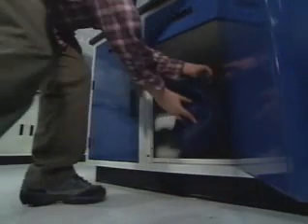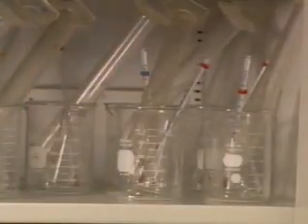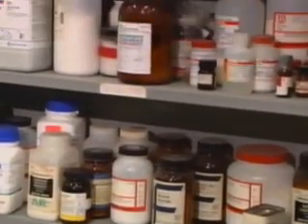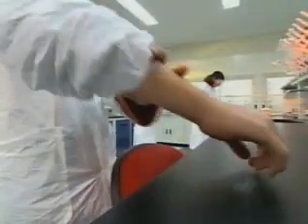Well, they're certainly off to a good start in the pregame preparation, which is a judging element in this competition. Look there, you can see the crisp, clean, uncluttered work areas with nothing on the floor. Over there, all of the glassware is in the cabinets. None of it is sitting in the sinks. All of the chemicals are properly stored. Over here, you've got the kids gearing up, putting on safety goggles and lab coats, rolling up their long sleeves. You just get the feeling that everybody's getting ready. They've got their heads in the game, and it's going to be a great day.